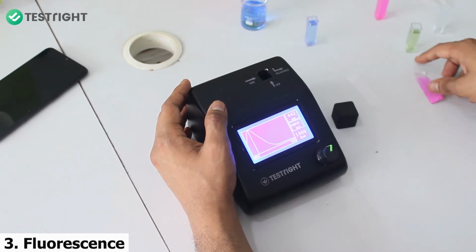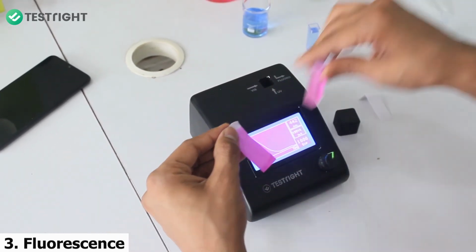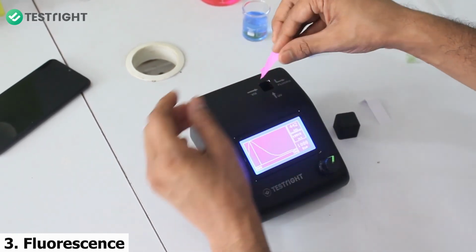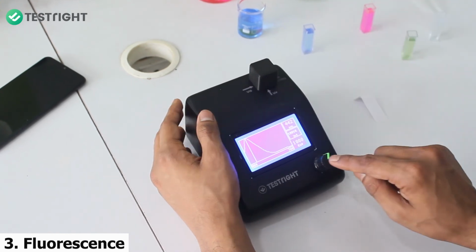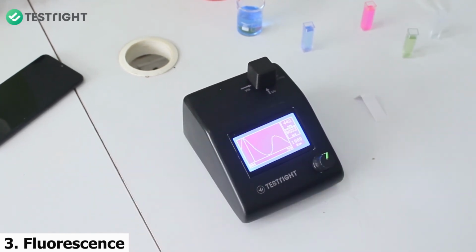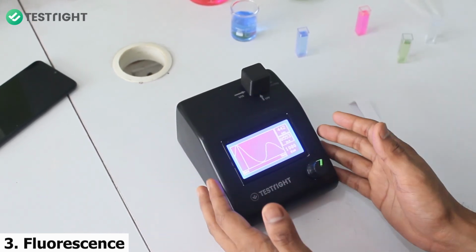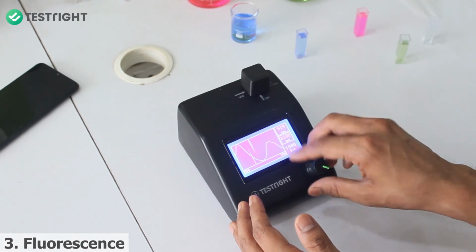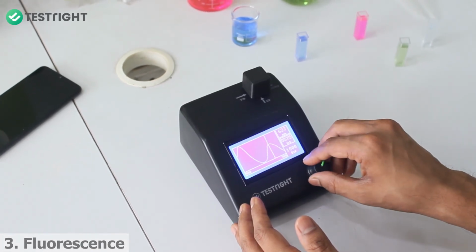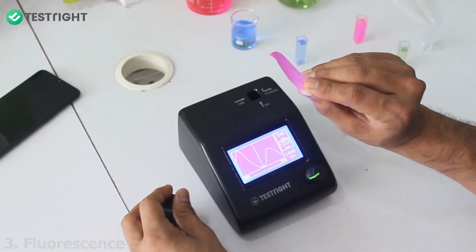Next, I'll take a sample of this paper but coated with rhodamine. I'll put this sample in, cover this again and try to look at the fluorescence. Now you can see the fluorescence is being emitted by both the optical brightener in the paper as well as the rhodamine which has been coated over it. So in this way we can even take fluorescence of the strips.